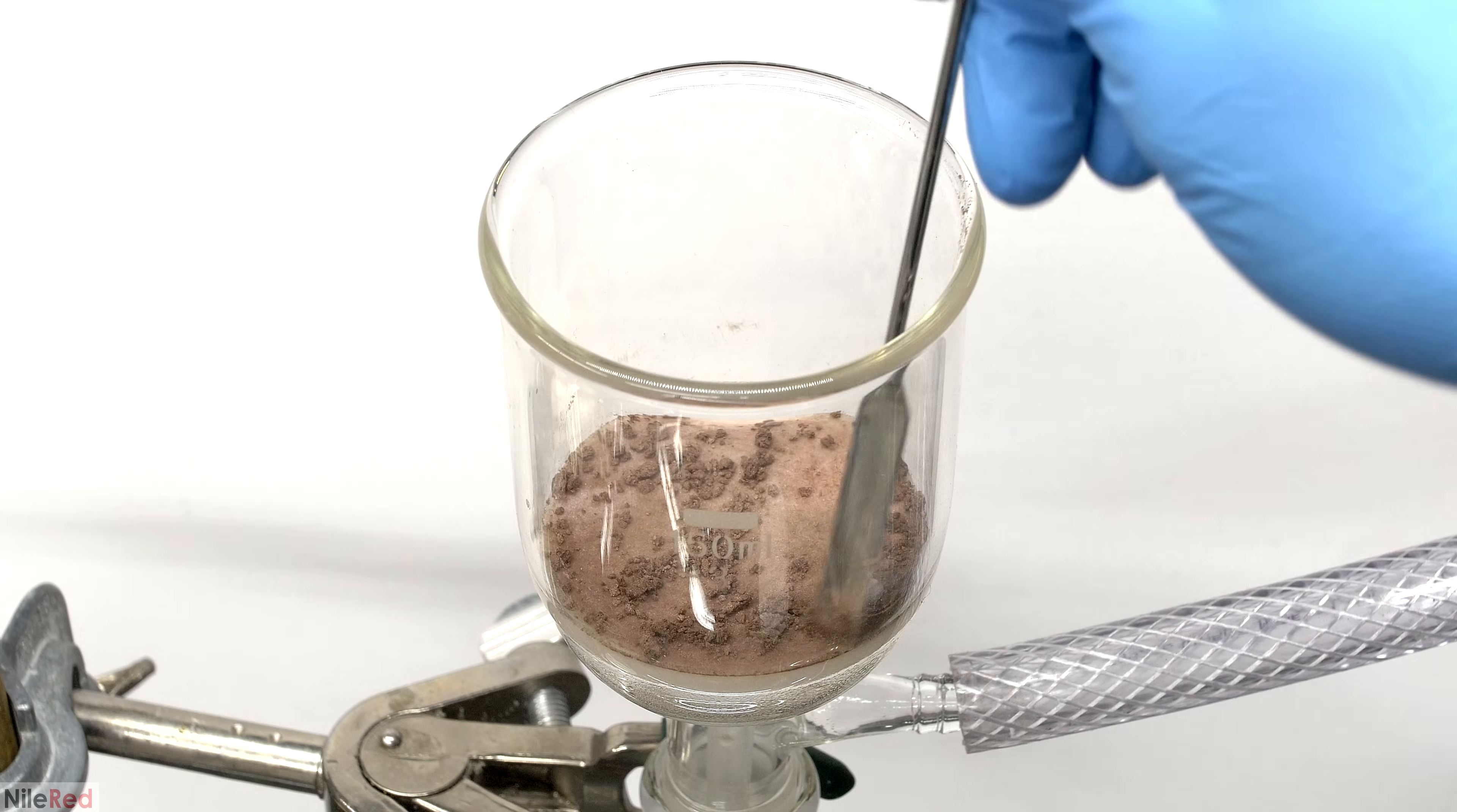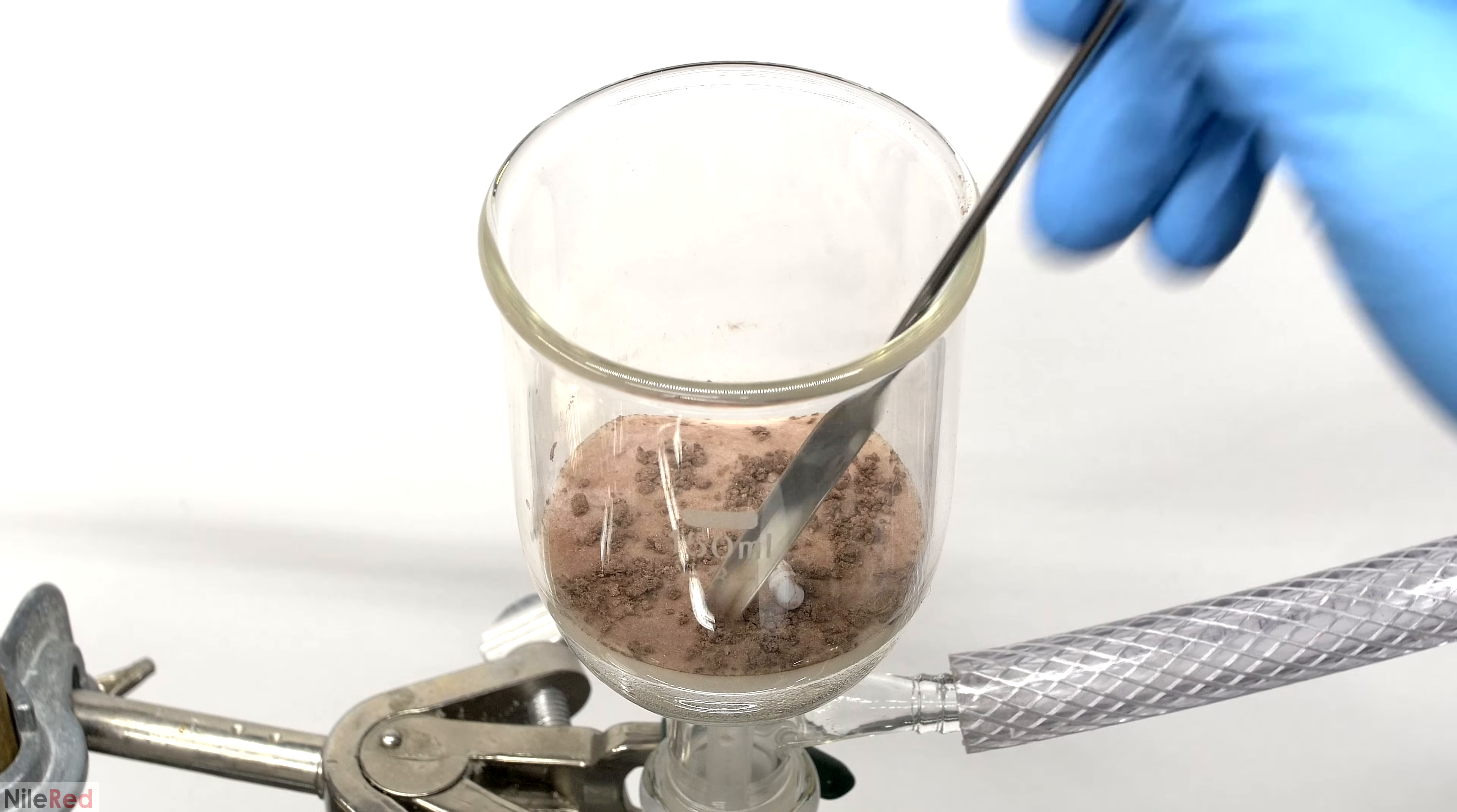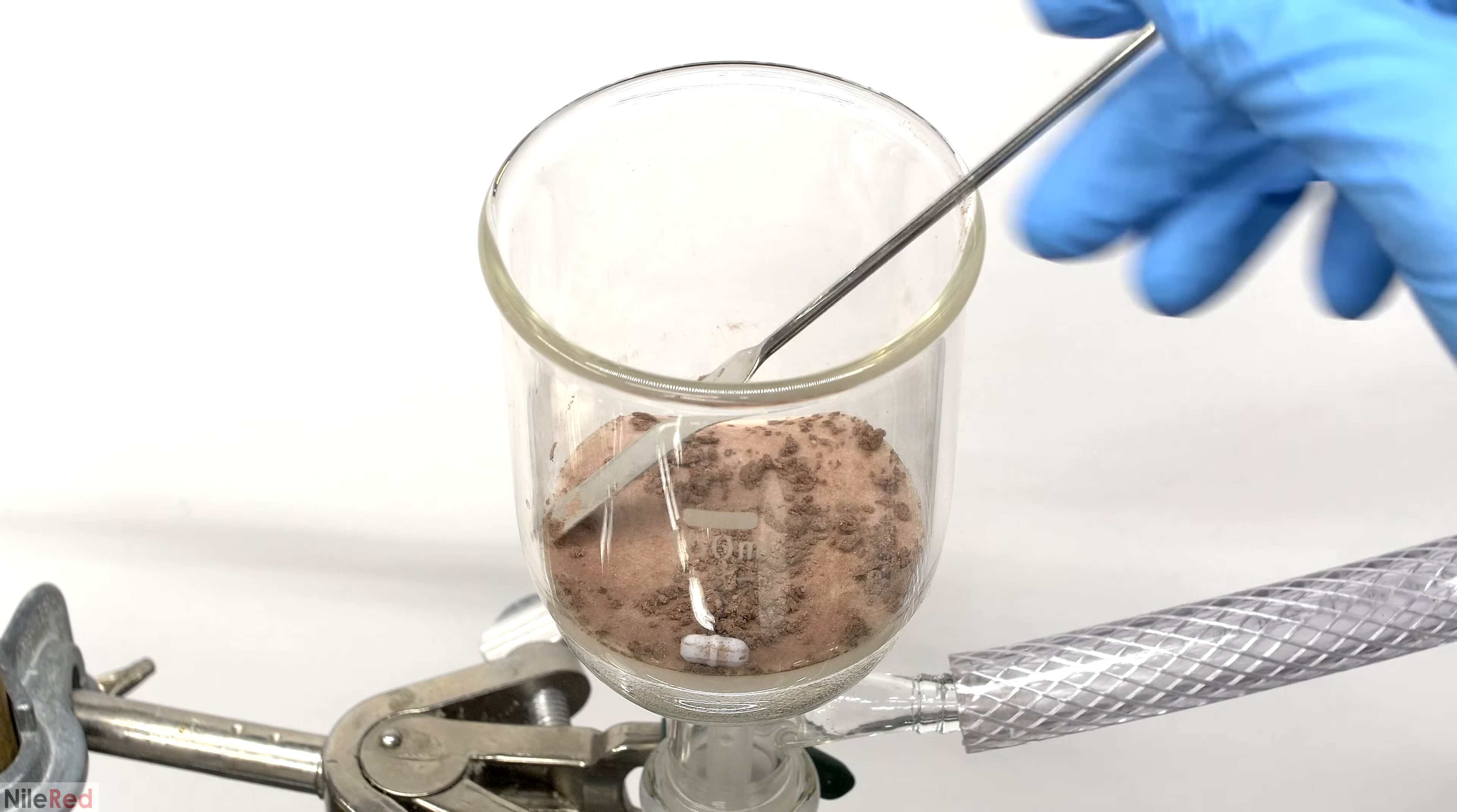Pure paracetamol is white or colorless, so what we have here must be pretty dirty. Luckily, it should be pretty easy to clean this up, and I just need to recrystallize it from water.